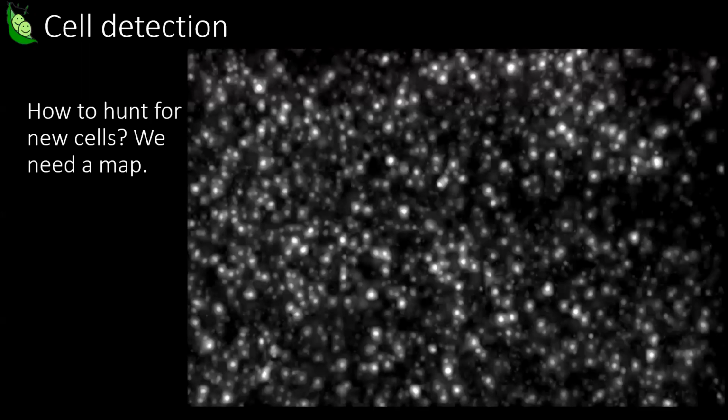All right, so how do we hunt for cells? We had this idea you could use the max projection image and use a segmentation algorithm on that. But in functional imaging, if we want to use a functional algorithm, we need a similar sort of map which represents the activity of the cells rather than this static image. And so we create a map that looks like this, that's based on the correlated activity of pixels.